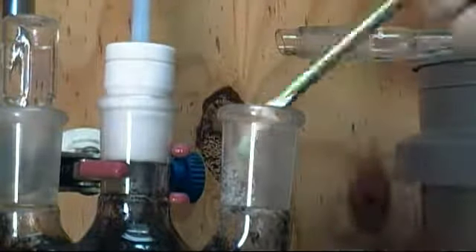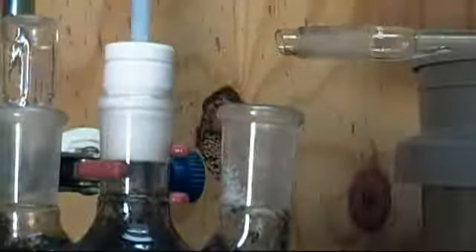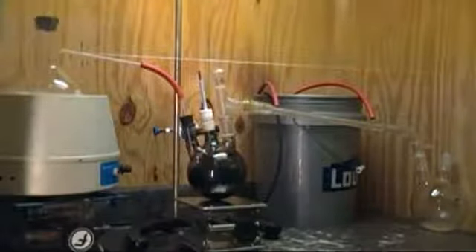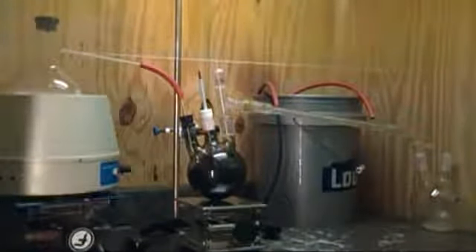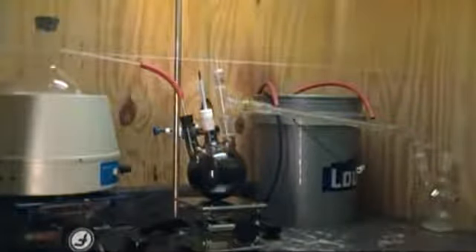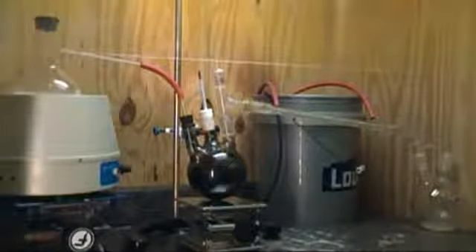Now slowly add 20 grams of potassium carbonate while mixing if possible. Once all the carbonate has been added, we can now steam distill. Steam distillation is very simple. You'll just need a container to boil water and a way to route the steam into your flask.